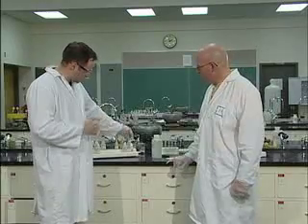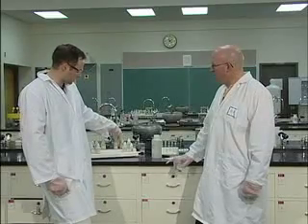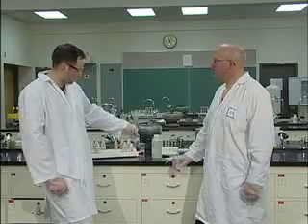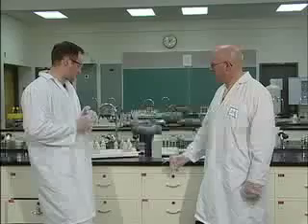You'll notice that all of your acids and bases are very high molarities. We're talking 6 molar hydrochloric, 6 molar sulfuric, 3 molar nitric, which we're lucky that we even get to use, 6 molar sodium hydroxide and 6 molar ammonium hydroxide. So they're very high concentrations. They will hurt you if you get them on your skin. That's why the gloves are so important.